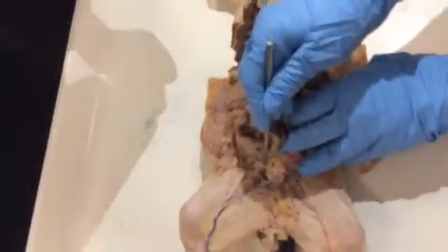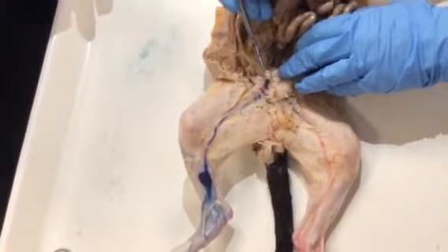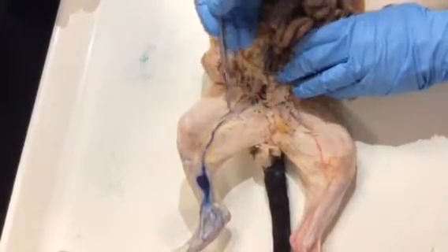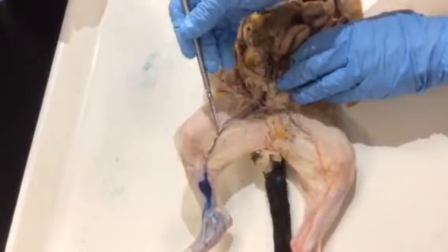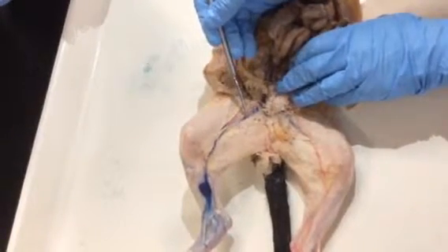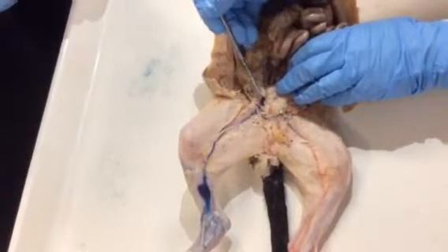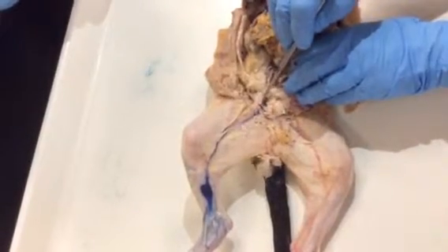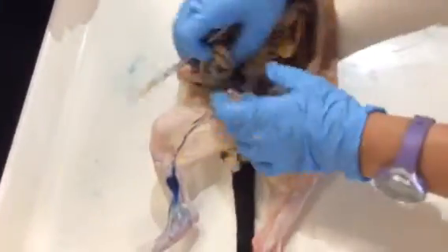When we follow the flow past the iliac, so like here they open this nicely, so if you go behind on this side, we have the external iliac reaching into the femoral artery, into the leg. Coming back is the great saphenous vein, which continues and then merges together, keeping going as a femoral vein. The femoral vein comes out, goes into the external iliac vein. Here we have a common one, but we probably cannot see it all the way.